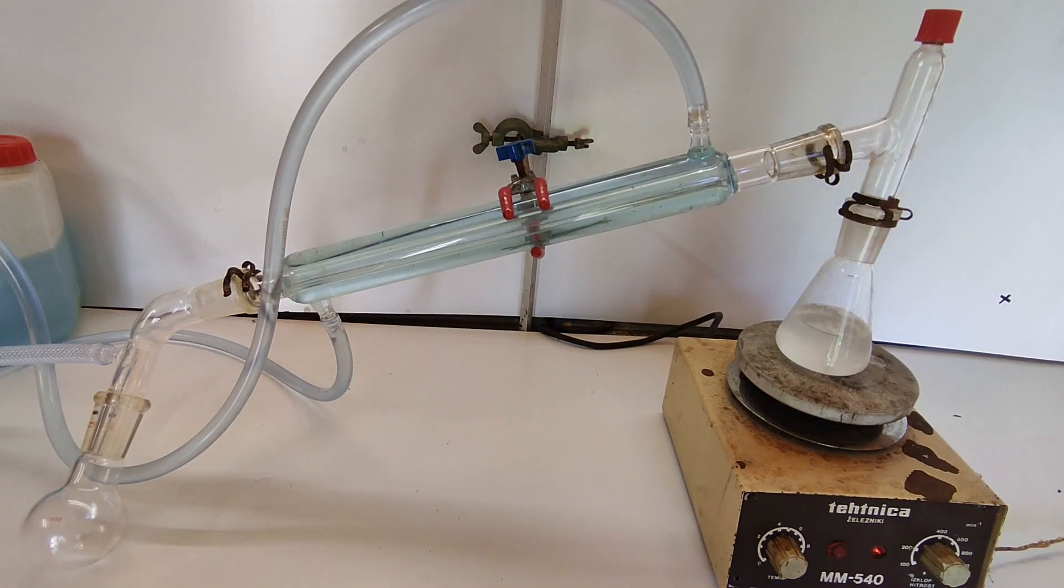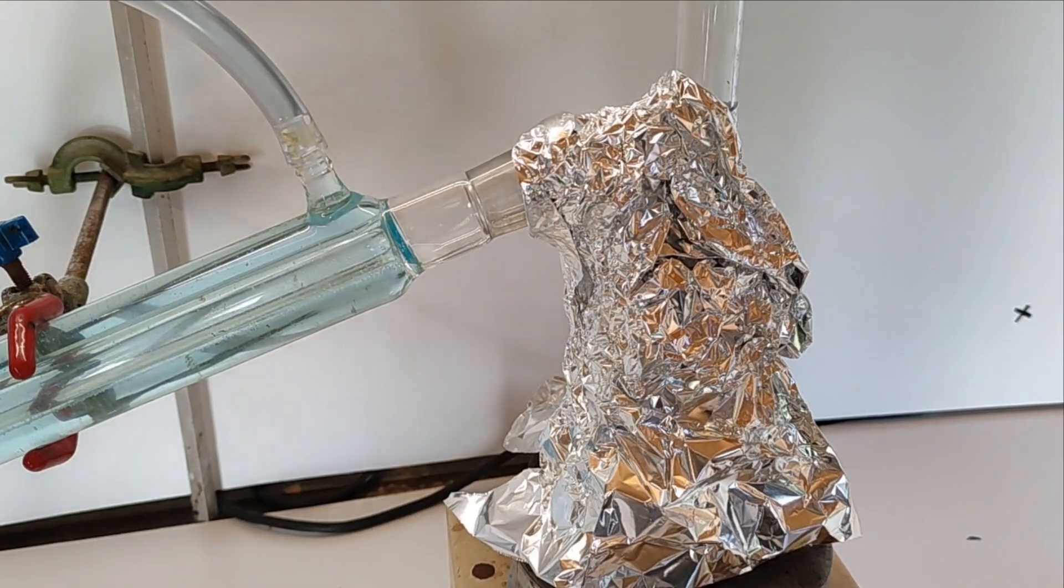Most of the methanol is then distilled off and the flask is cooled and allowed to prepare for workup.